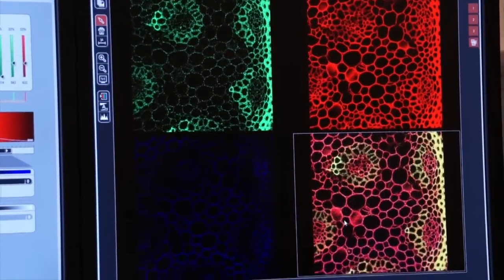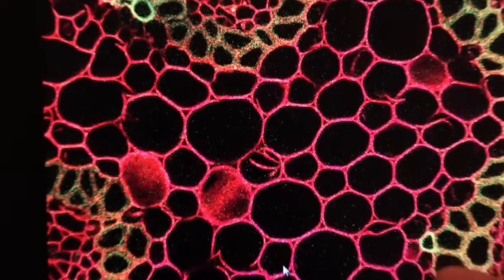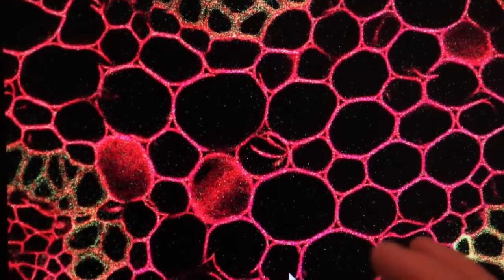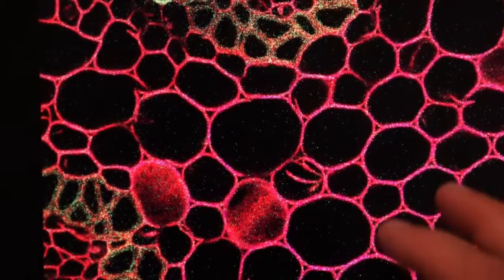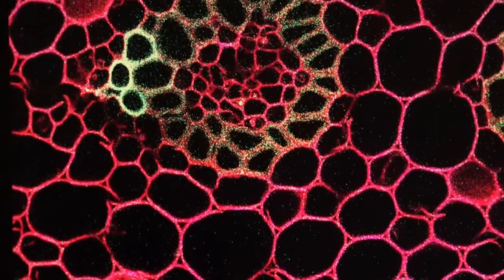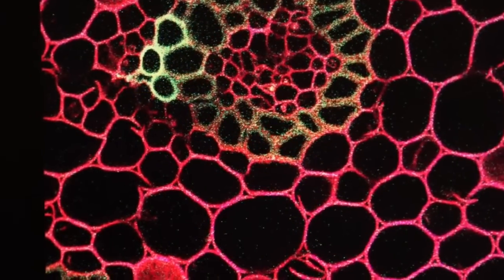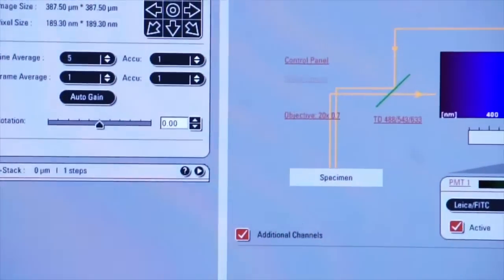But you might say, well, Mark, we increased our resolution. How can it be grainy? Well, again, there's noise in the system, and so by using line and frame average, we can eliminate some of that noise, reduce some of this pixelation, and increase the resolution of our image. So let's go back and engage line averaging. Let's select 5 scans per line. We'll click on Capture Image again.